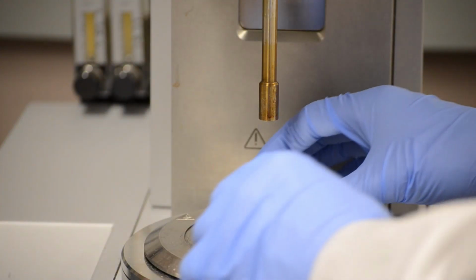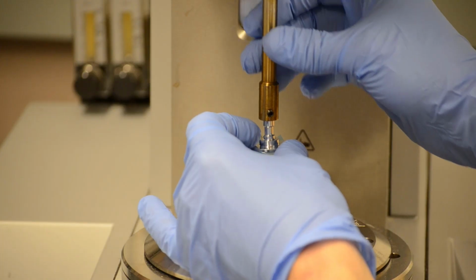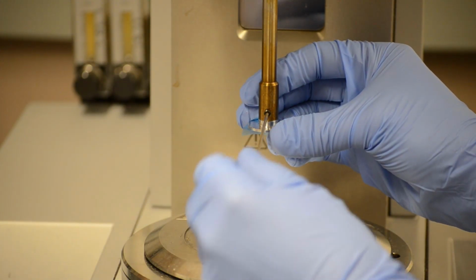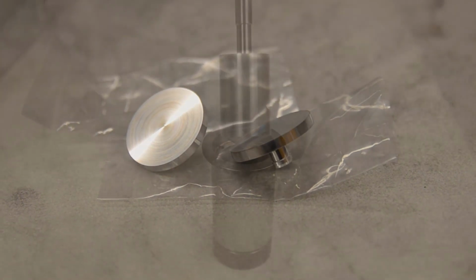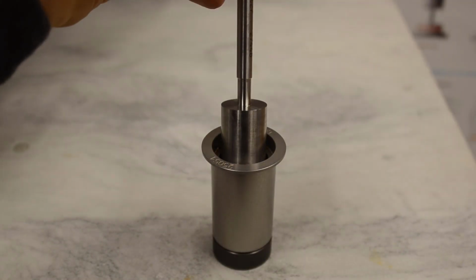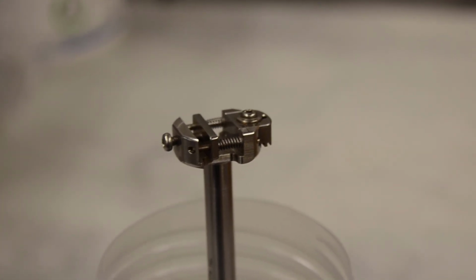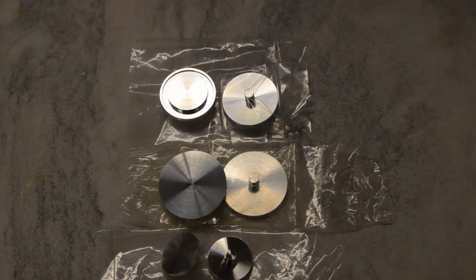A rheometer consists of components that can impose and measure stresses and strains on a small sample of liquid or solid material. A variety of test geometries can be used for different samples. Parallel plates, cups for liquids, or fully contained cells for volatile samples, and many other sample containment systems are all available. These components are known as sample carriers, measurement systems, or test geometries.